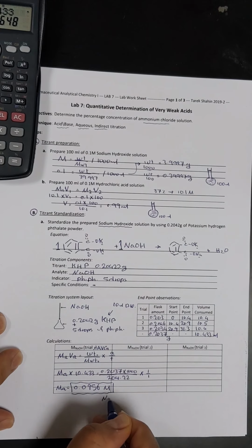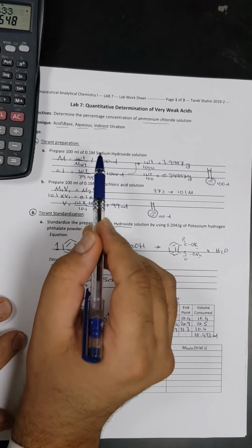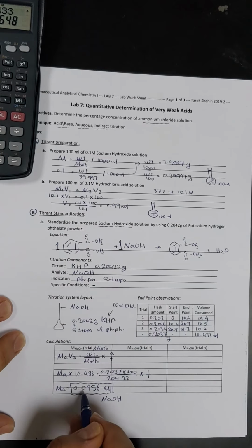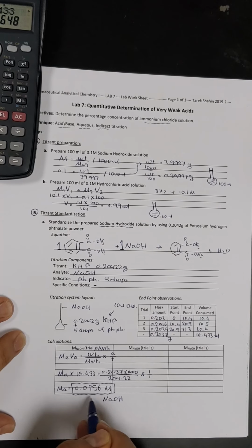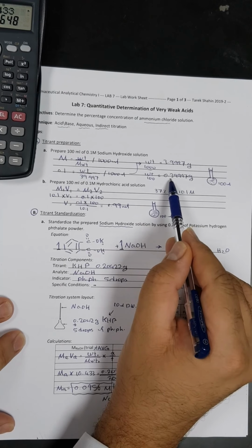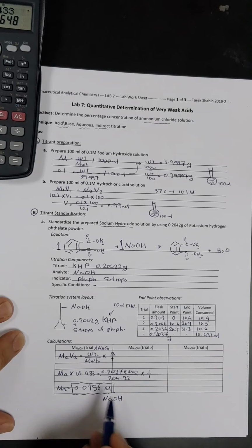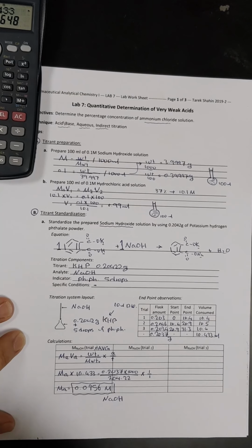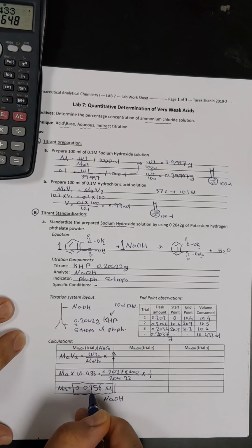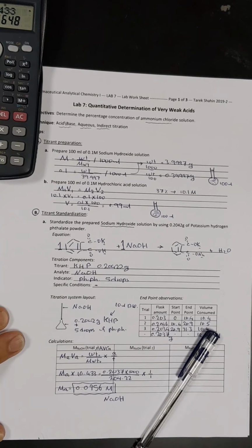So this is the molarity of the prepared sodium hydroxide solution. If you notice, we wanted to prepare 0.1, but we got 0.0956. If you remember, this is due to the inability to take this exact amount. So we took, I think, 0.34. So we had a lesser amount, that's why we will have lesser molarity. But anyway, we are sure that the solution inside the volumetric flask now has a molarity of 0.0956 molar. Let's proceed with the second part of the experiment.